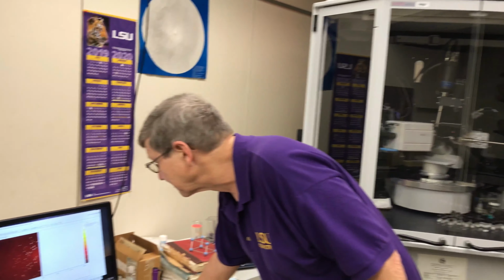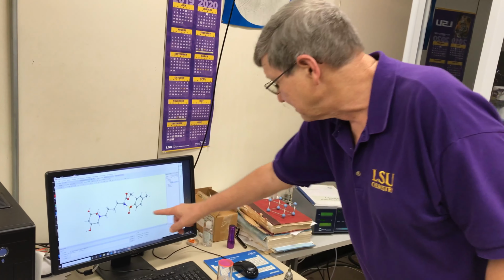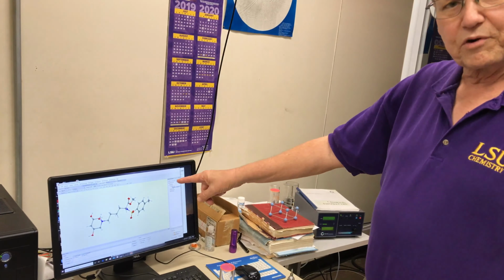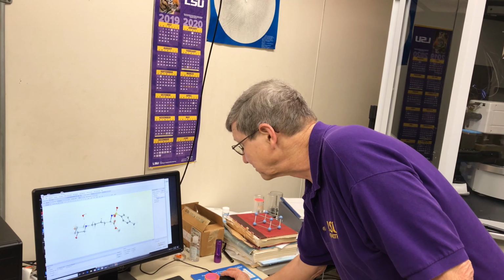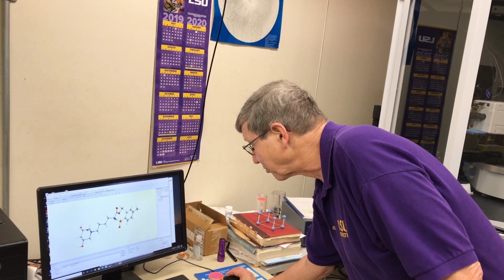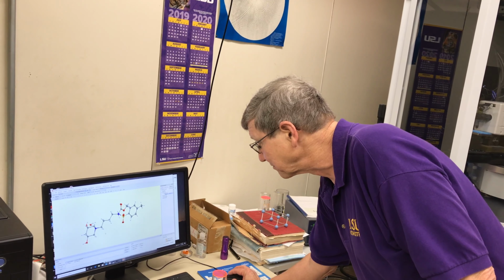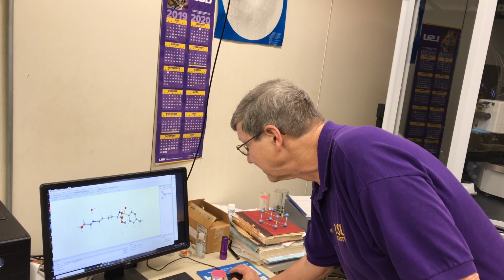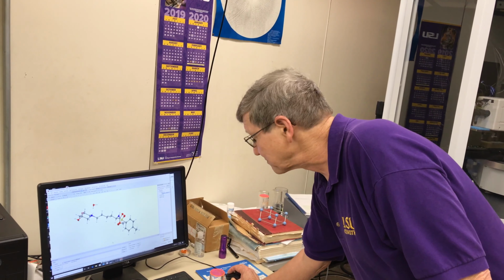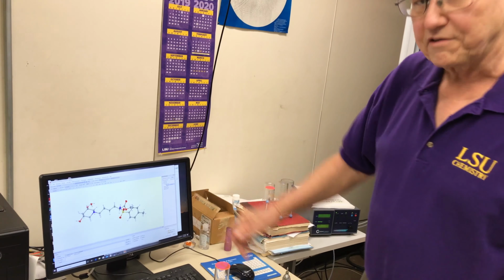Let's see, if you look at another thing I have here, this is the results of one such experiment we did a little while ago. And you'll see there is a molecule there. All right, we get three-dimensional coordinates for all these atoms in the molecule. The gray ones are carbon, the blue ones are nitrogen. That yellow one there is sulfur and so on. So you can see there's a tremendous amount of structural data we get from this.